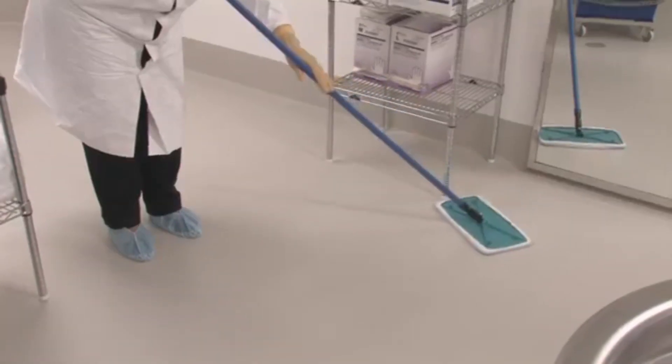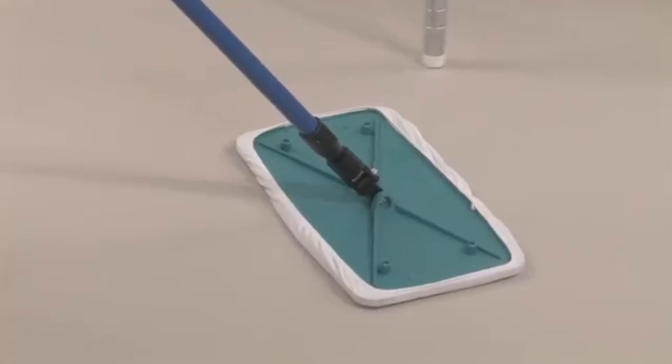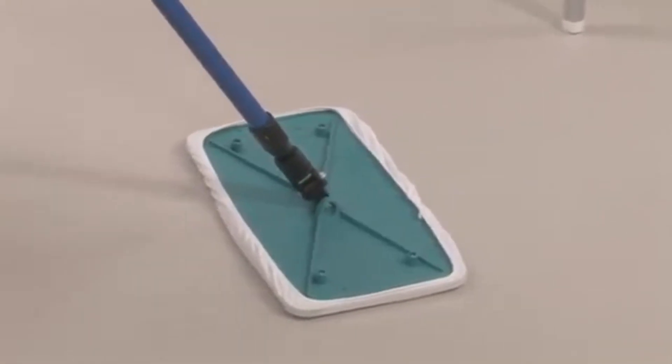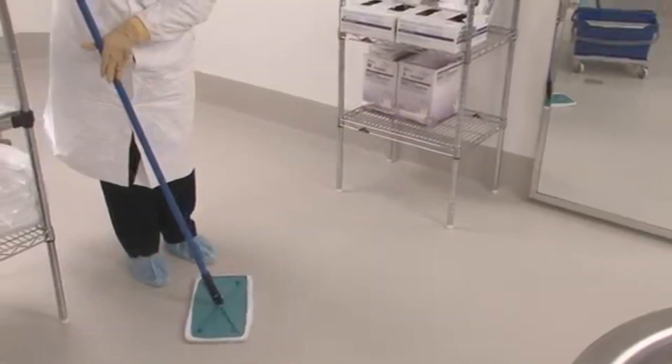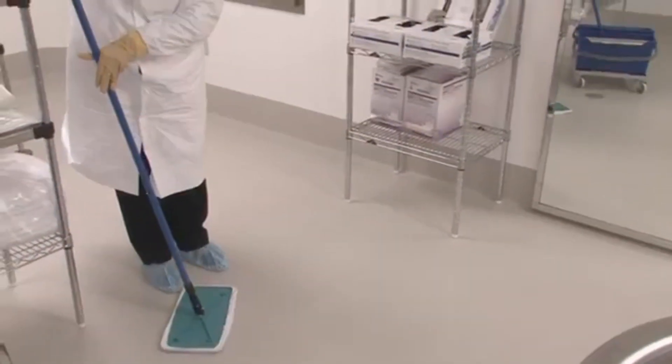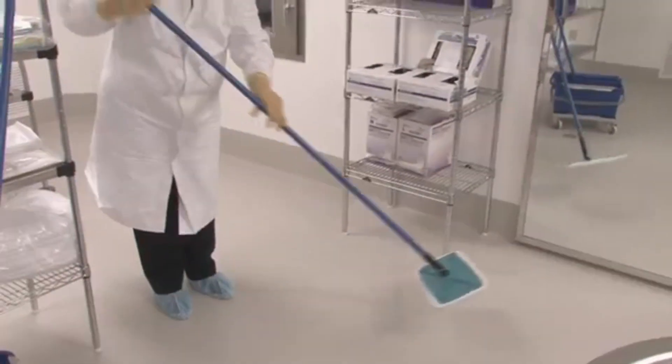Floors in the buffer area, ante-area, and segregated compounding area must be mopped daily with a cleaning and disinfecting agent, and never during aseptic operations.